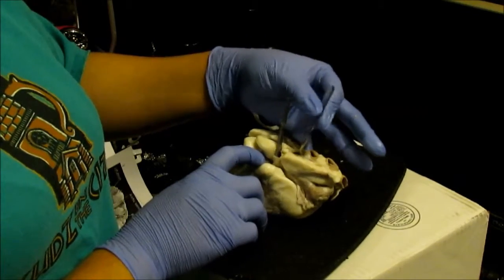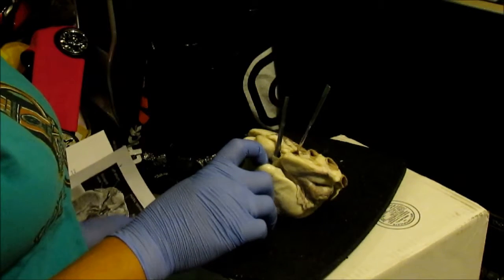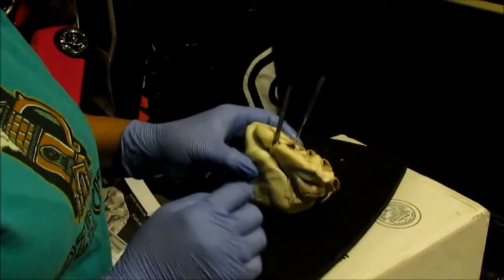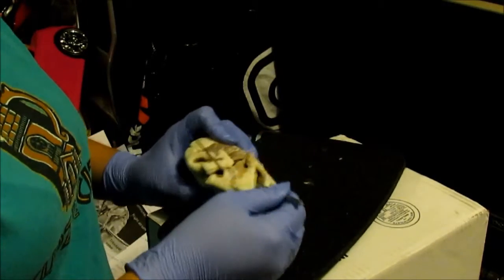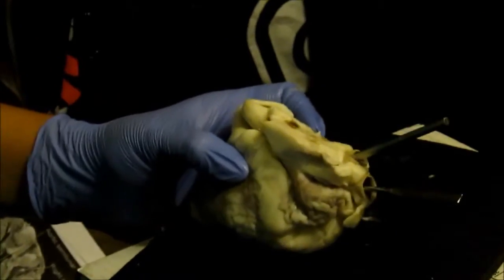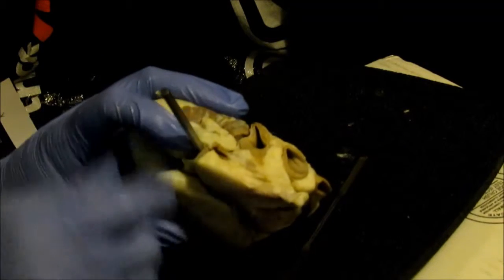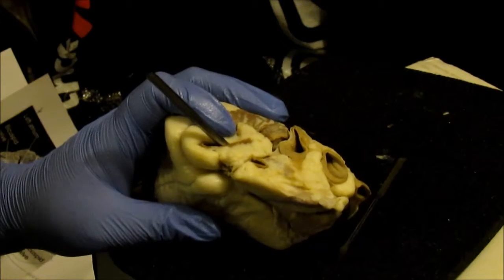Where the spatula is coming out from is the brachiocephalic artery. And then I'm going to show you the superior vena cava, I believe, is right here. And the pulmonary vein right there. Blood that's going into the pulmonary trunk is actually going to the lungs, and it's deoxygenated. And the blood going into the aorta is going to arteries, and it's oxygenated.